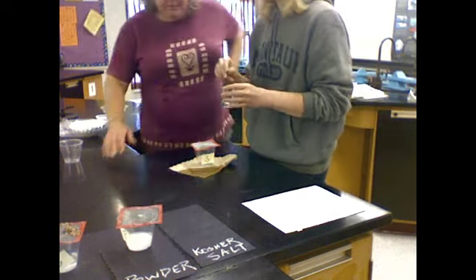Whoa. I see nothing but water on this screen, I don't see anything in the cup, and I see nothing different than what was in this before we poured it. So I'm going to say that the screen didn't work. Definitely not. If I can't see it like I saw the gravel, it must not have worked. So again, we're going to ask you why. Why do you think it didn't work for the salt and for the powder?